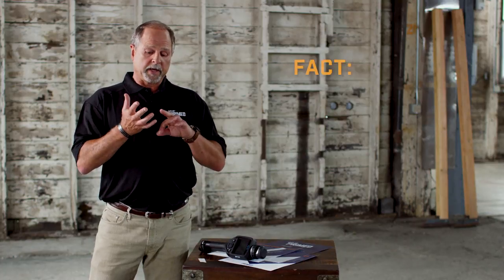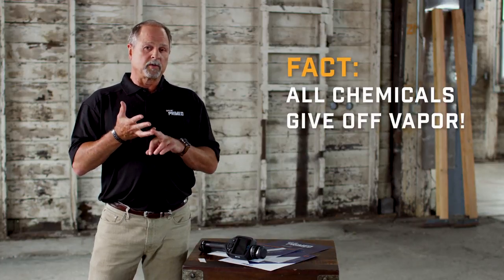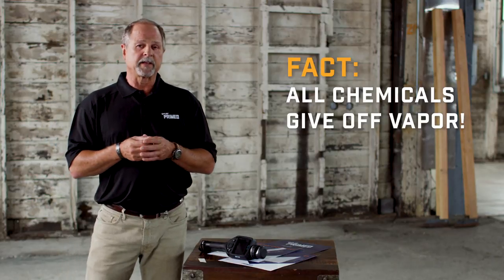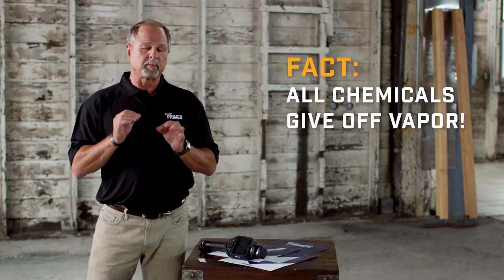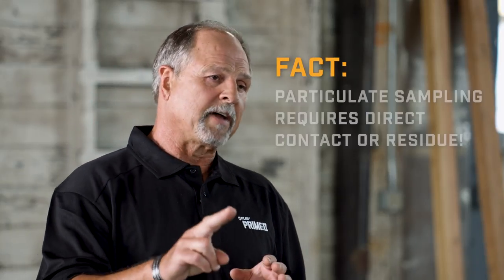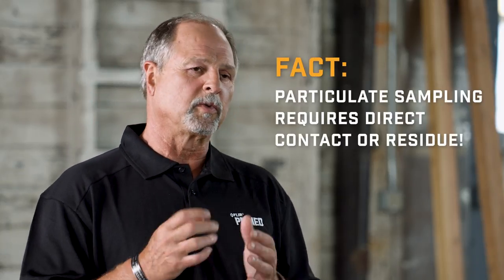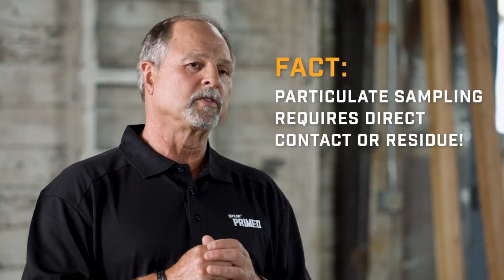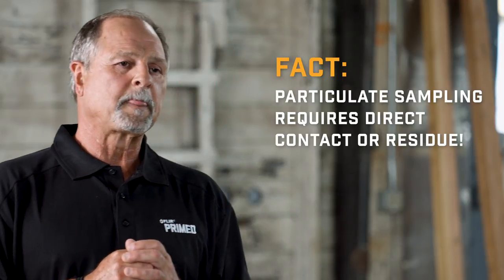With vapor sensors, you have to understand that all chemicals, including solids and liquids, are going to give off a little bit of gas that could be picked up with the detector. With swabbing or particulate detection, we're going to actually have to have physical contact — usually used with narcotics, explosives, residues — but it's going to take some direct contact.